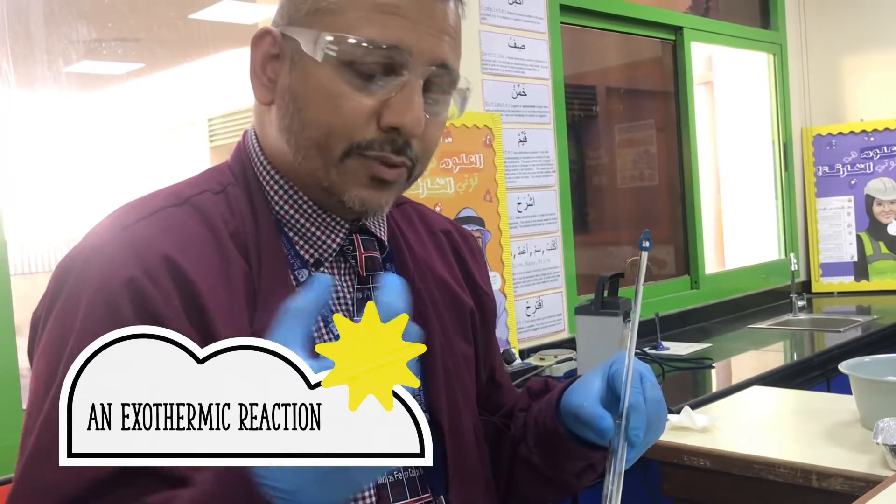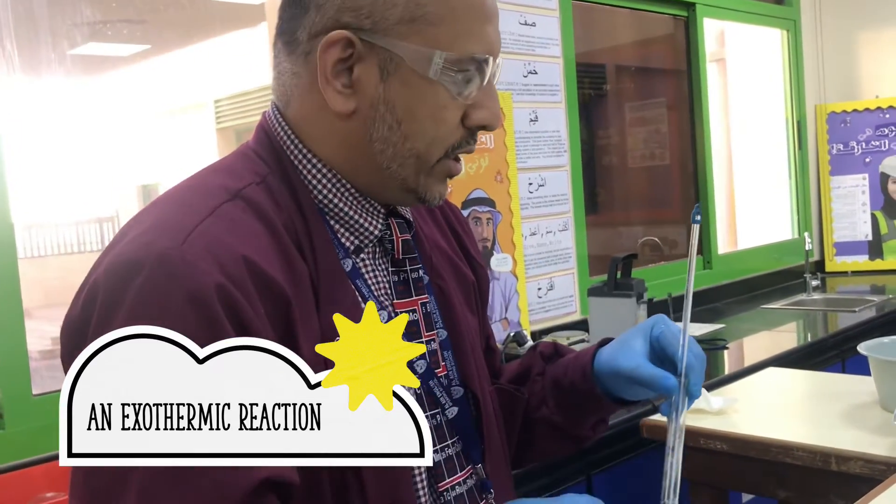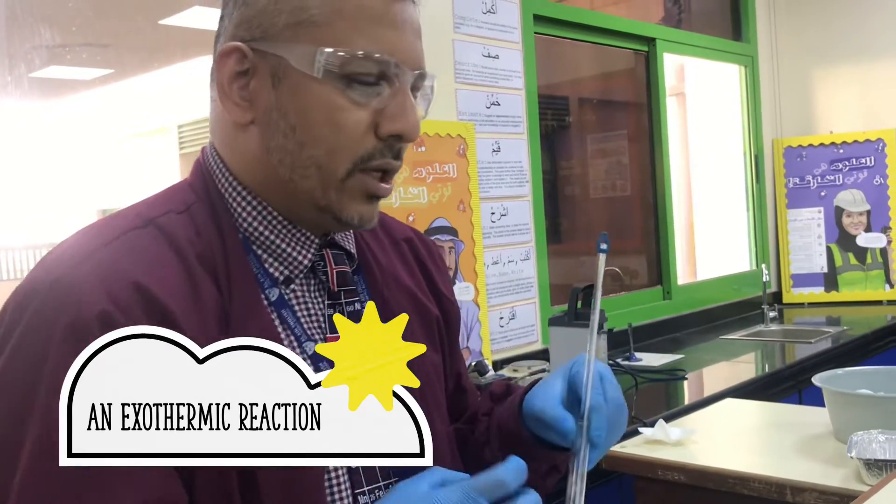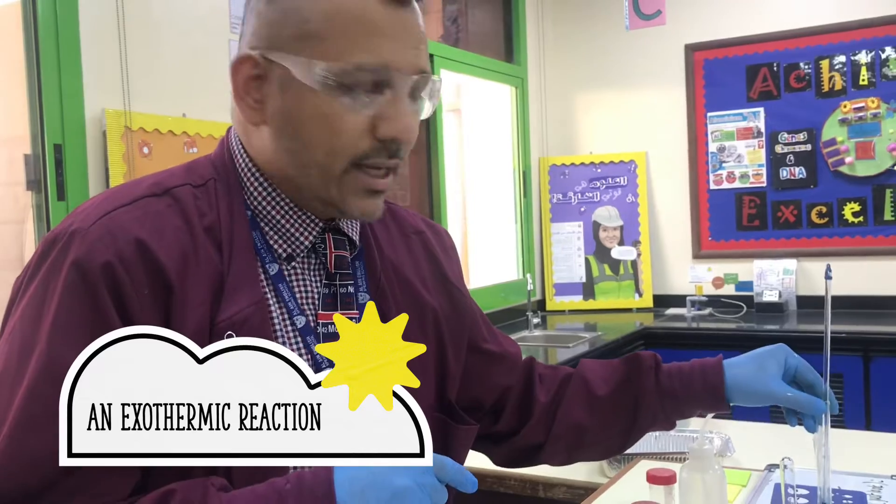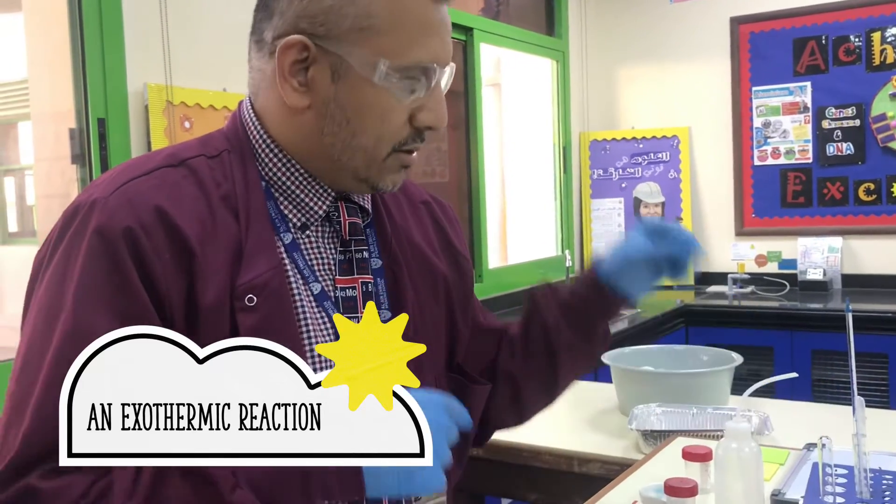The energy was required to break bonds between the water molecules and the copper sulfate and we are now getting that energy transferred back out. So heating it is an endothermic process and adding water back in is an exothermic process.